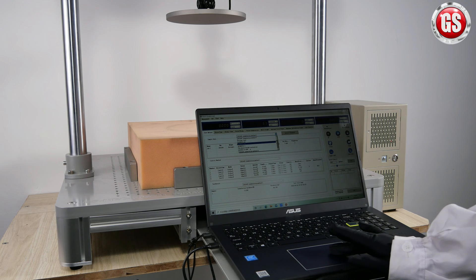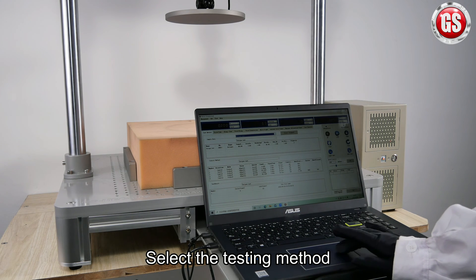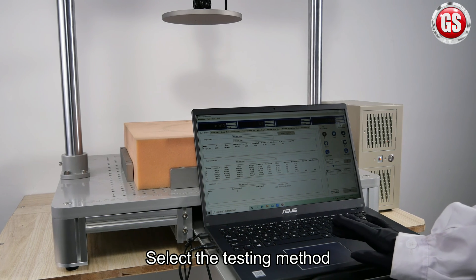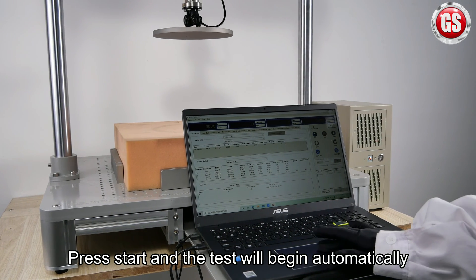Then select the testing method. Press start and the test will begin automatically.